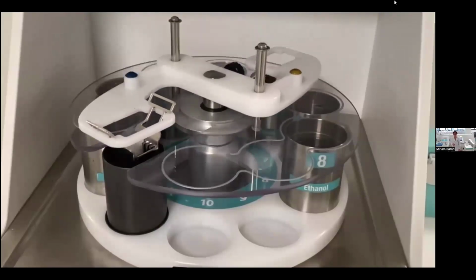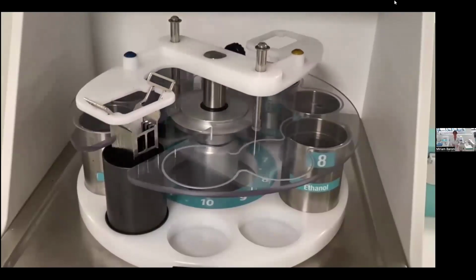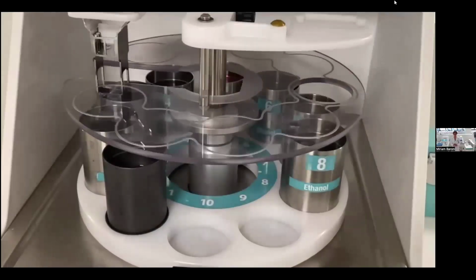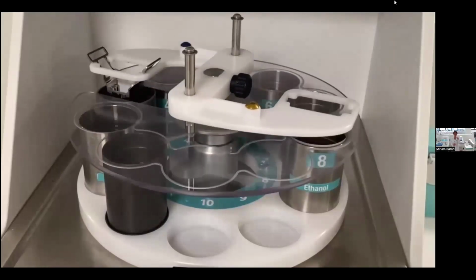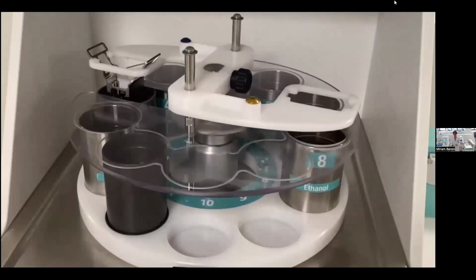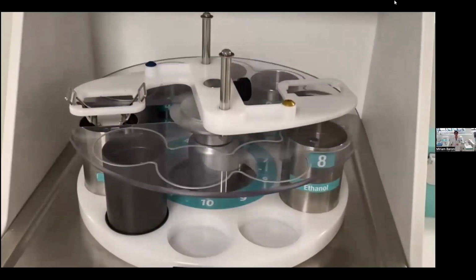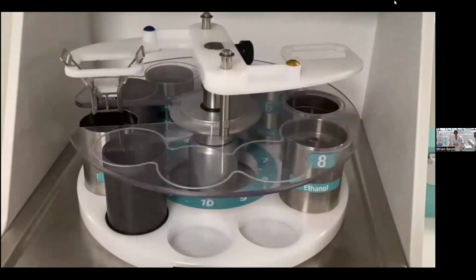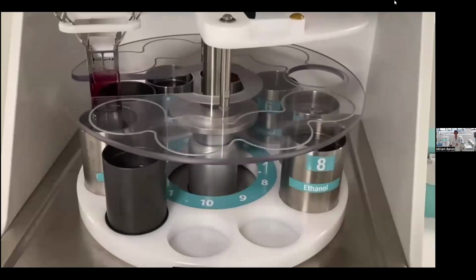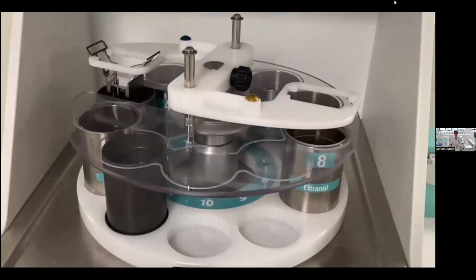The first one is the immersion in heated FineFIX. That is a special reagent that fixates, dehydrates, and clears the tissue. Due to the thin section and to the heating of the FineFIX, the tissue undergoes a process in a very short time, in a few seconds. So at the end, it is very similar to a paraffin section that instead requires hours to get this result.